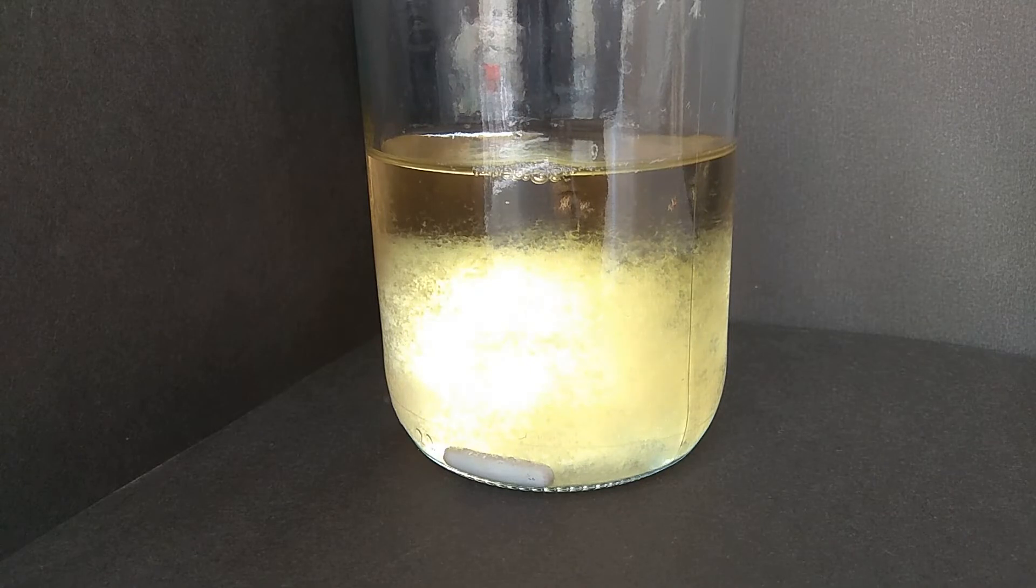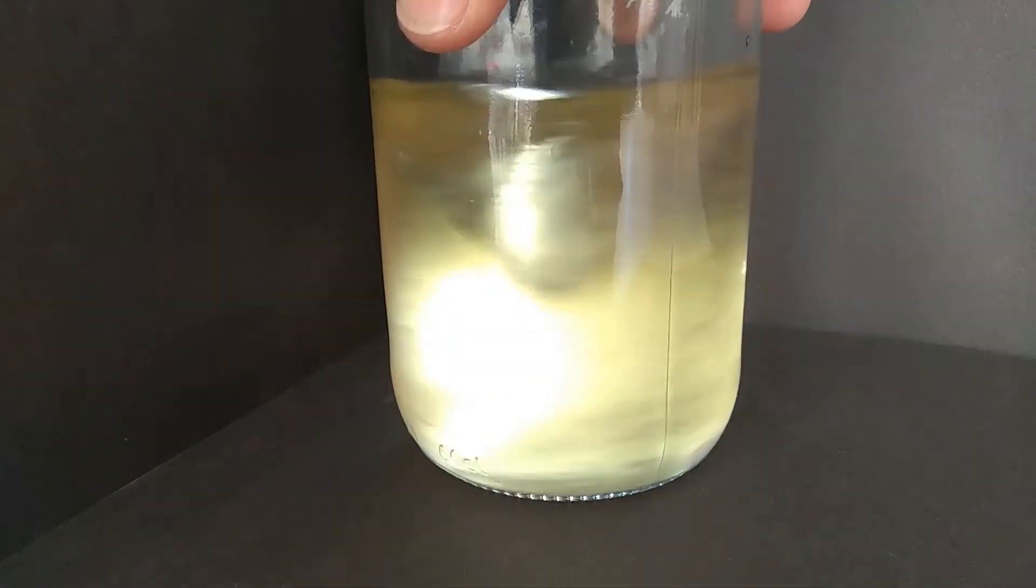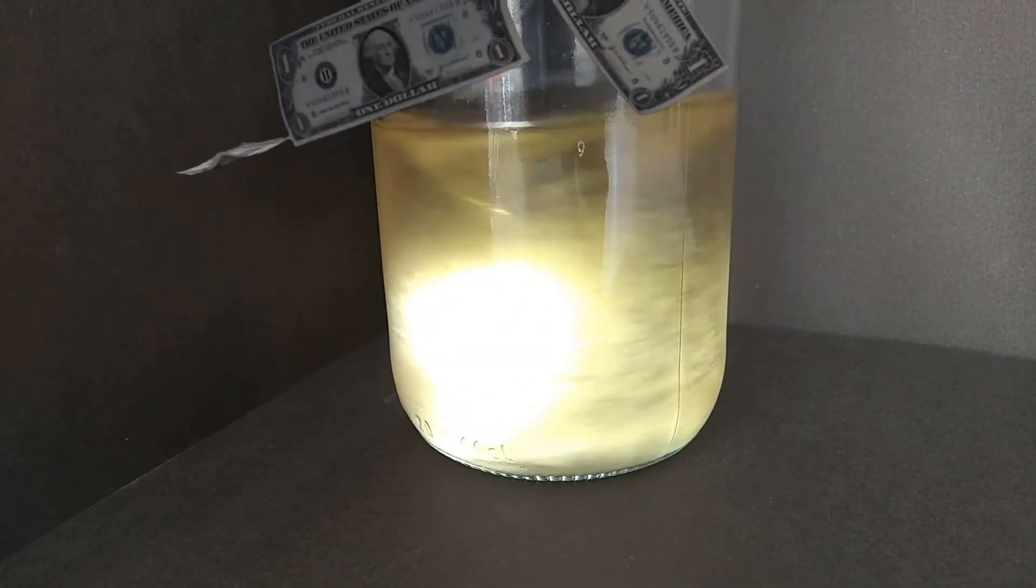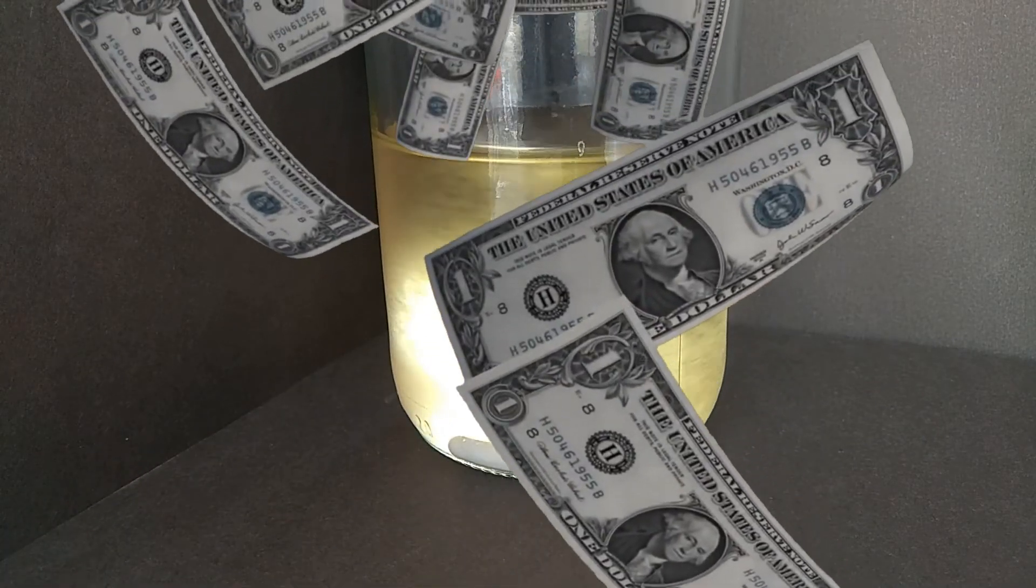Now we can use it whenever we want by sucking a syringe from it. Before use, let's shake the jar like this. Yes, friends, we will save money by getting about 35 syringes with this technique.